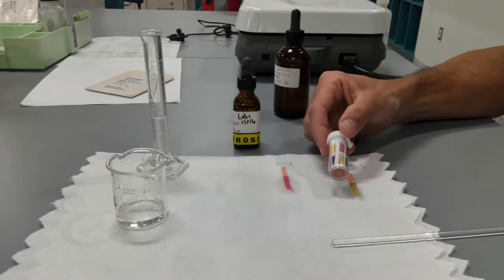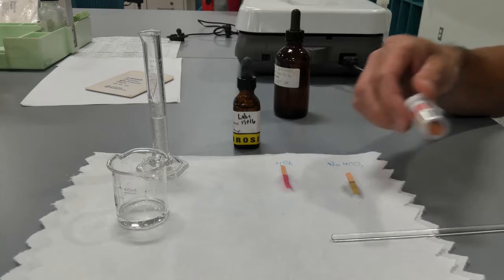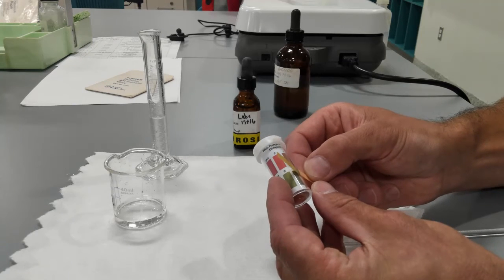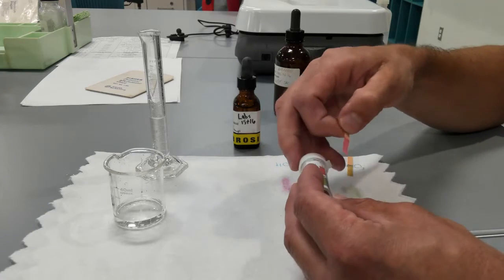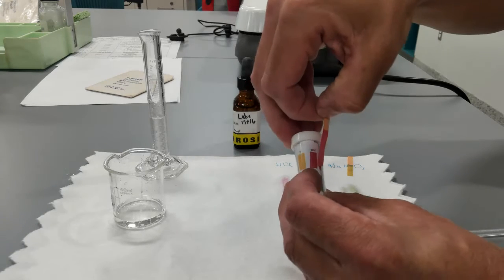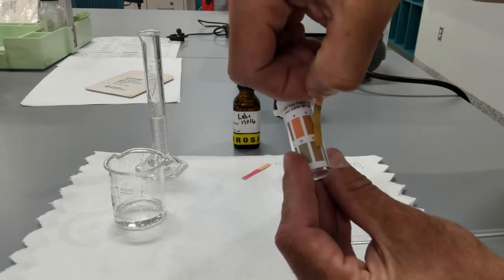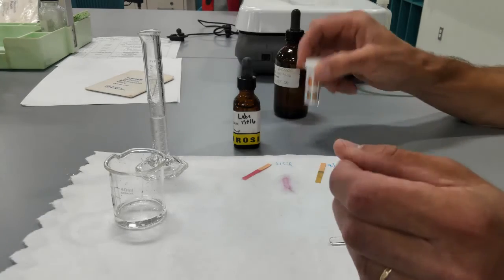So what is the pH? For bicarbonate, about 9, 10. Actually, look at the green areas, so it's more like 10. And pH for hydrochloric acid is between 1 and 2. And you can kind of clearly see that. I'm trying to see. Oh, actually, it's going to be even more than that, closer to 12 for bicarbonate. So 12 for bicarbonate, 1 to 2 for hydrochloric acid.